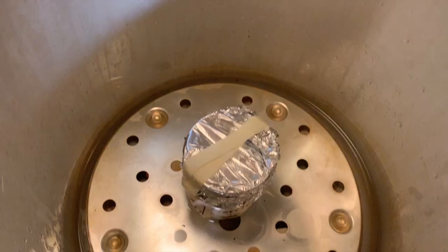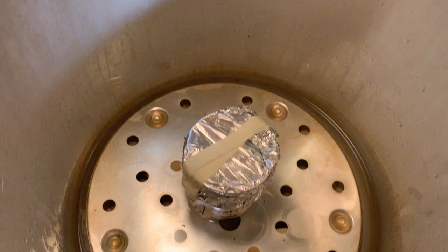After adjusting the pH to 5.4, I will place the solution in an autoclave with autoclave tape for 15 minutes at 121.